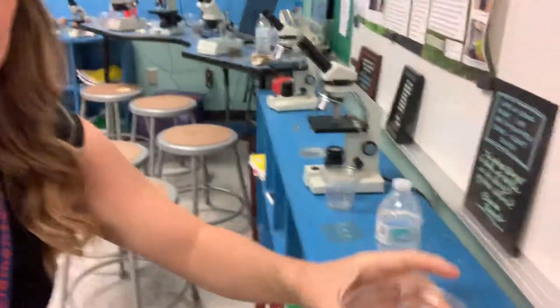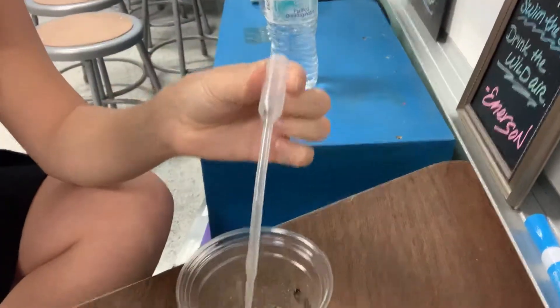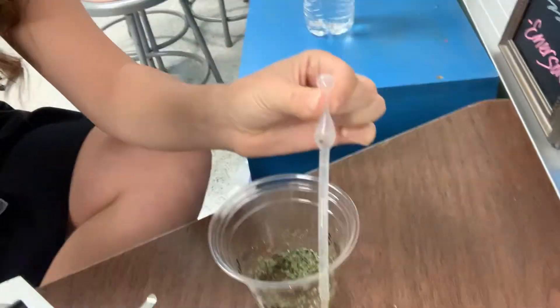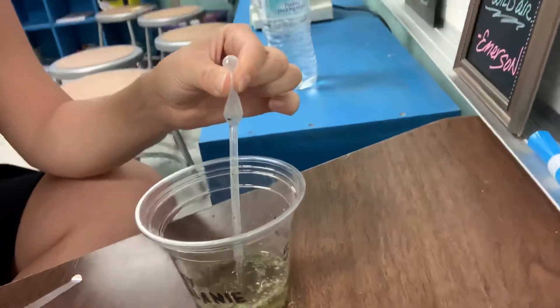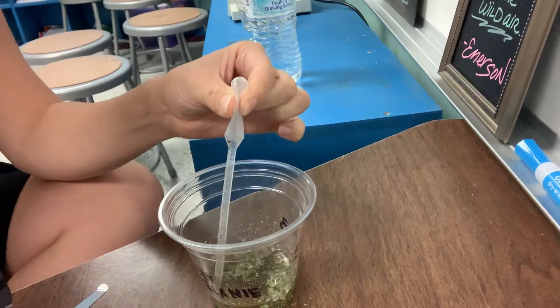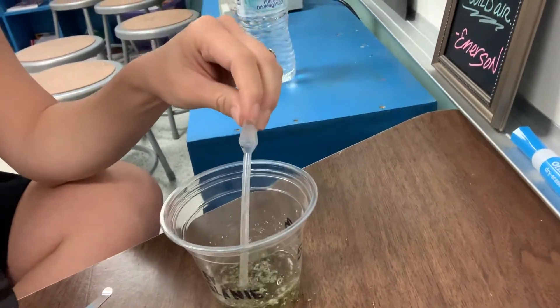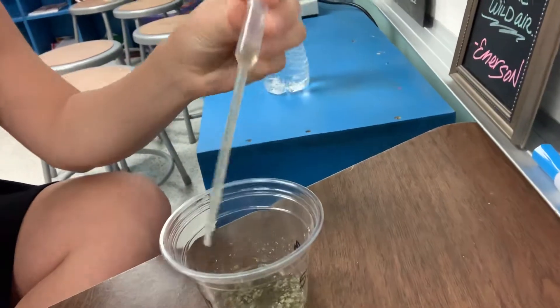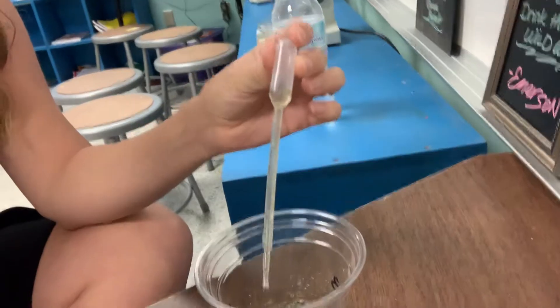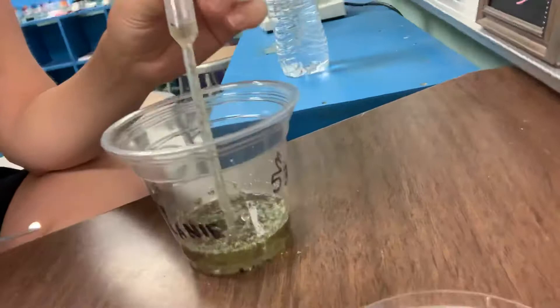When you're going to find them, you want to make sure that you squeeze the pipette first. Then you're going to place it inside of the dish. Now vacuum around the bottom of the dish as you're letting go of the tube, and it's going to vacuum up a mixture of liquidy stuff. You don't want to get the big things — you want to just get whatever is vacuumed up. Vacuum from the bottom of the dish.